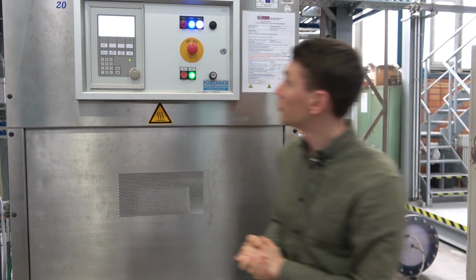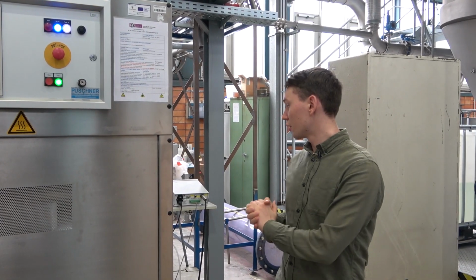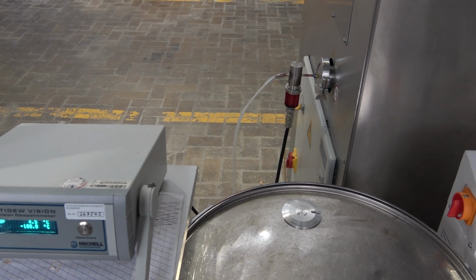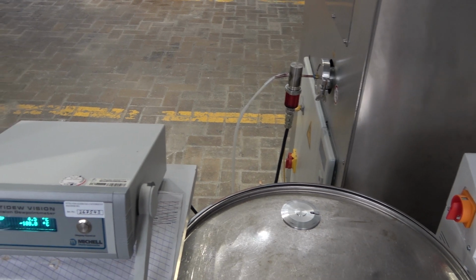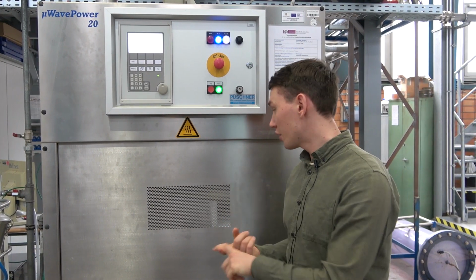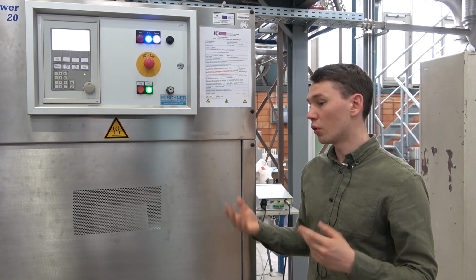And yes, what else do we got? We got online measurement of the water content of the air through a dew point meter that we got on this side, and we got everything else connected to the apparatus. For example, we can measure the weight and therefore the weight loss that's obtained through the evaporation of the water.